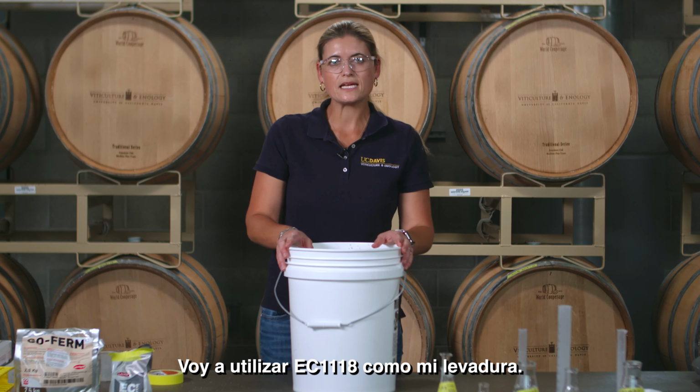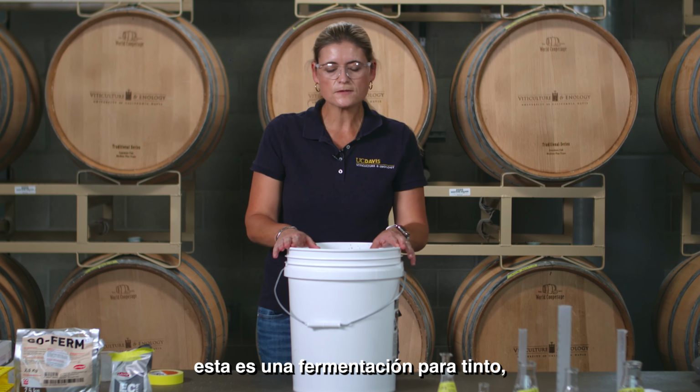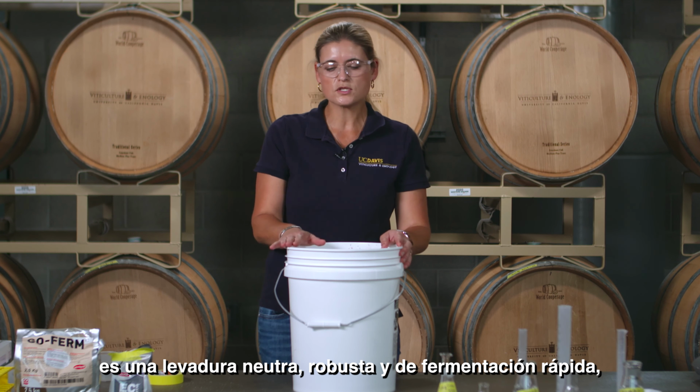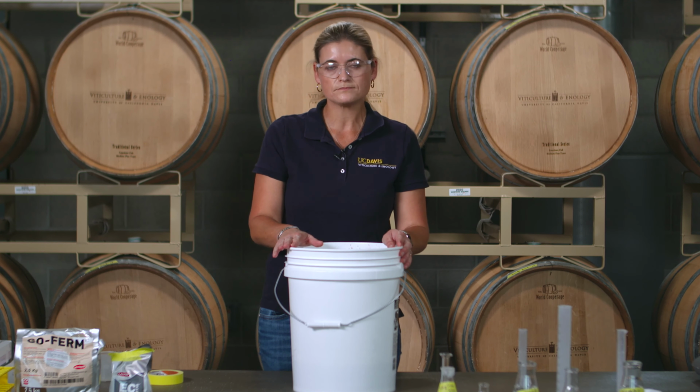I'm going to use EC1118 as my yeast. This is a red fermentation. It is a robust, fast fermenting neutral yeast. But you are welcome to use any other yeast that's suitable for the variety you are using.